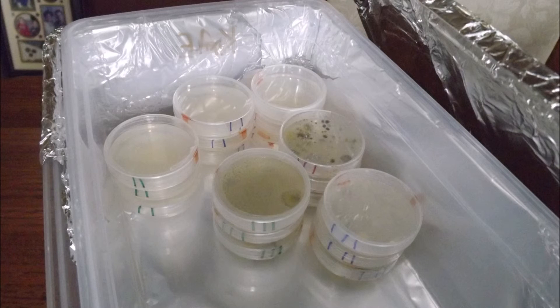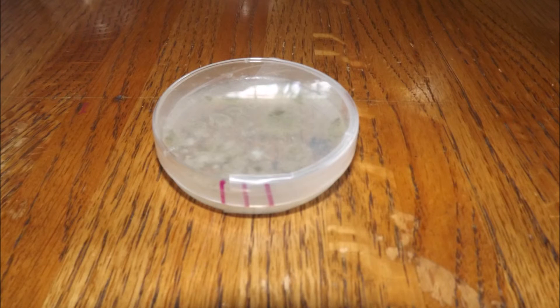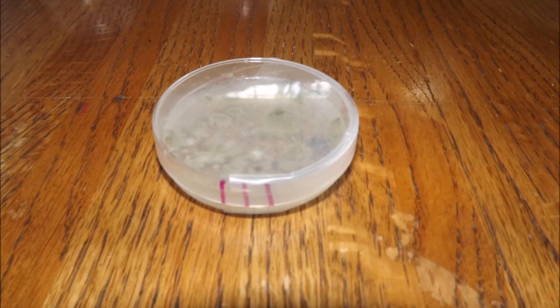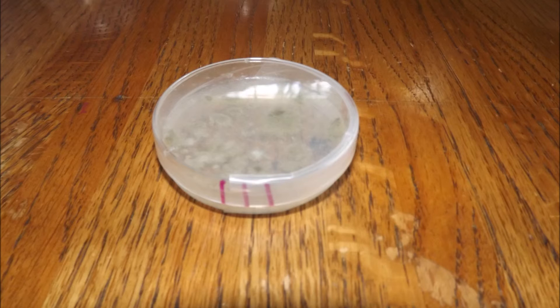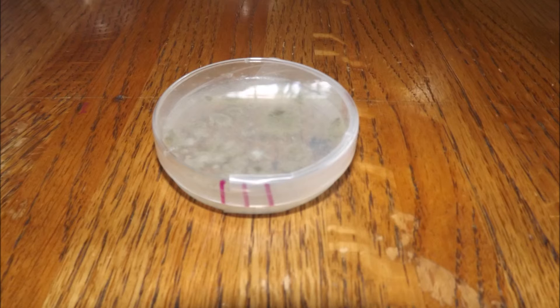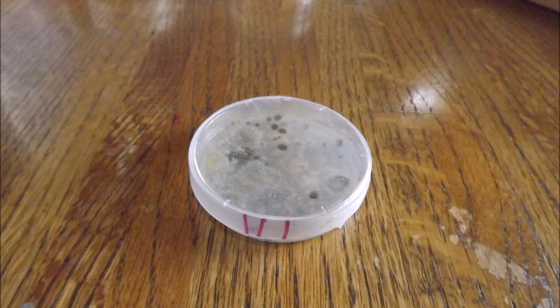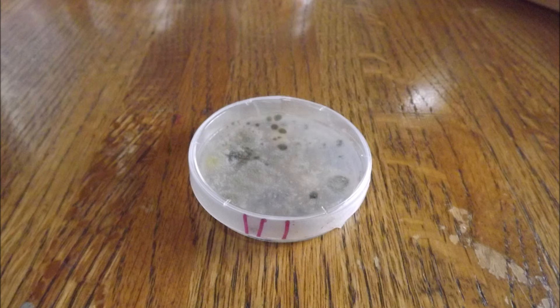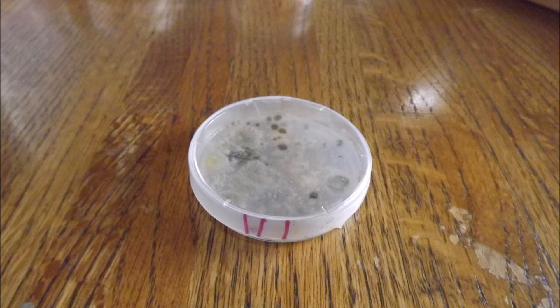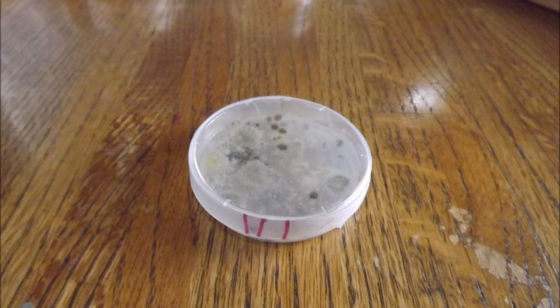But like a lot of other scientific experiments, there were complications yet again. Within a matter of days after taking the worms home the second time, contamination started to appear again. The contamination started on a Friday after school, and with it being a weekend, I did not have access to the school to try and salvage the plates.